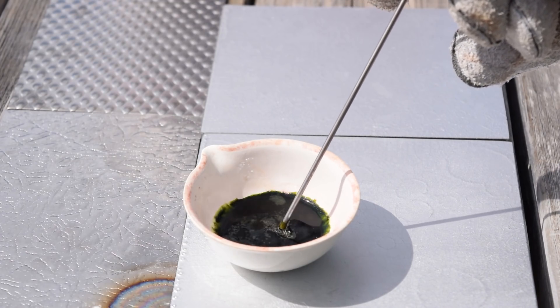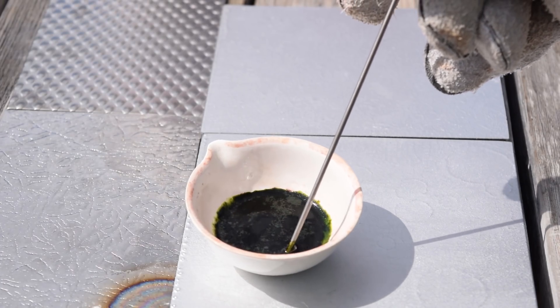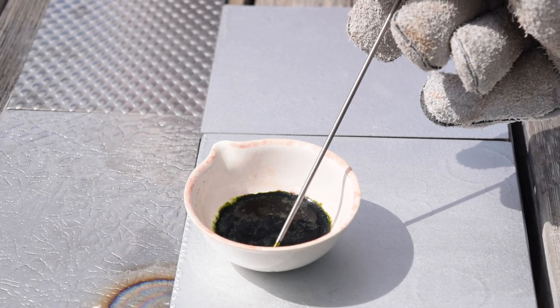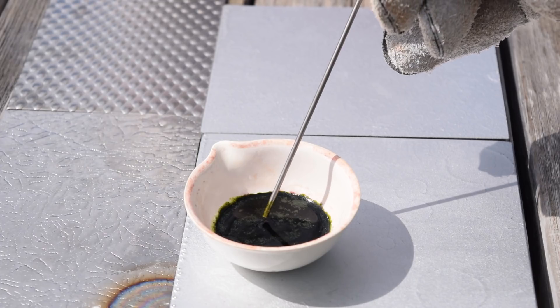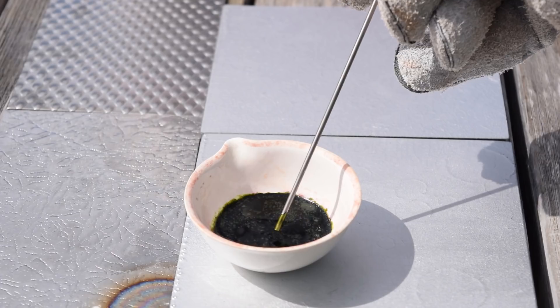I found a solution — a tungsten rod. Tungsten hopefully won't react with it; it's pretty unreactive. You can see some of the little flakes of the heptoxide shining on the top. I did this outside in the sunlight so you could see it better, also because of natural ventilation. I don't really have a fume hood yet, but I plan on building one soon.